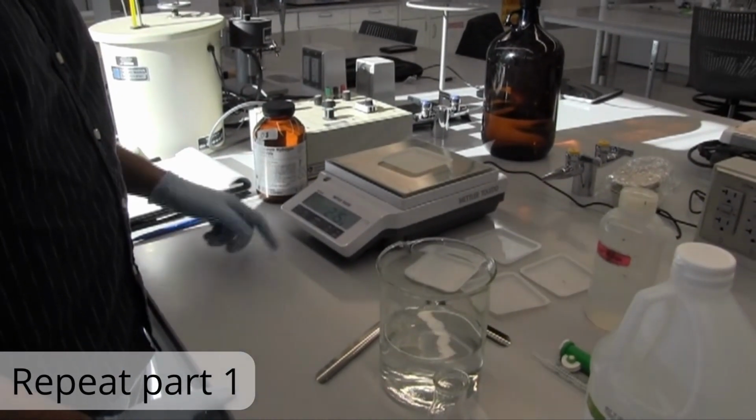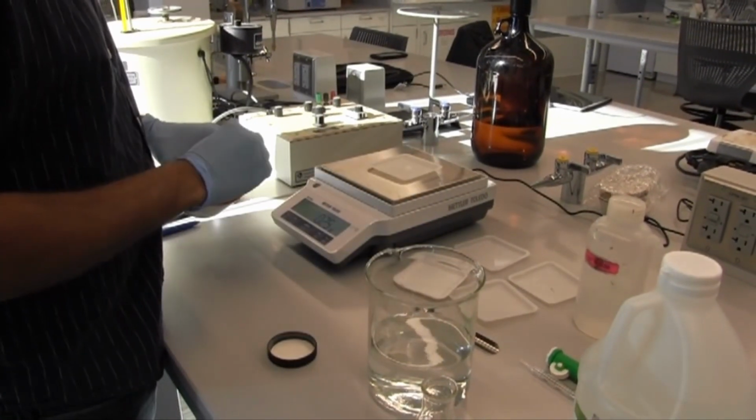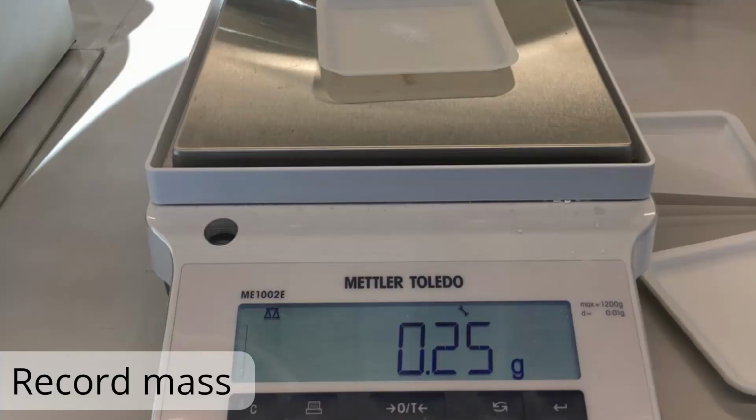And we'll go ahead and do a second trial of that. As in the beginning, we go ahead and weigh out some KHP. We'll record its mass.